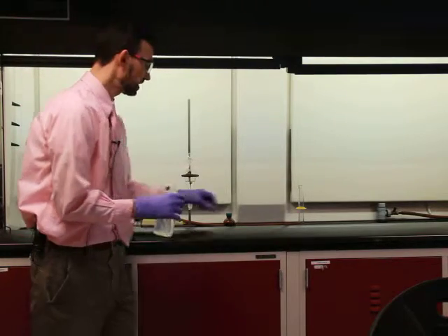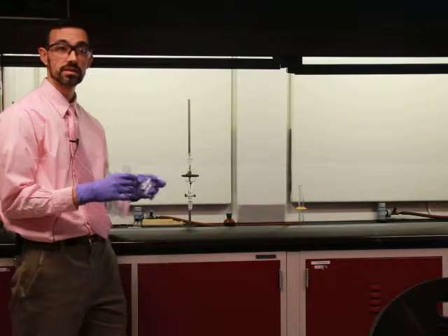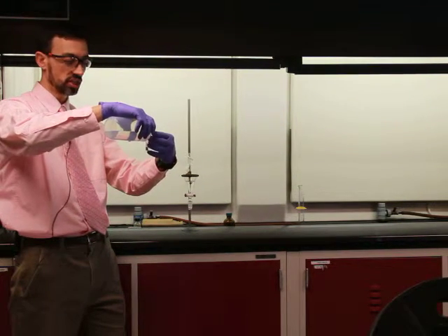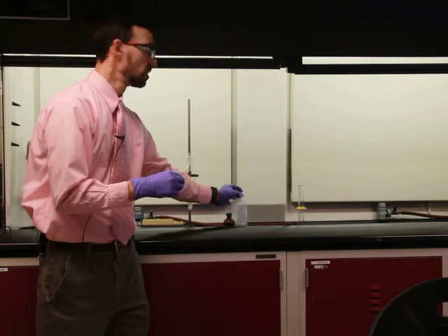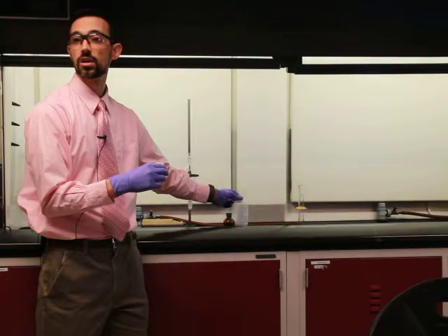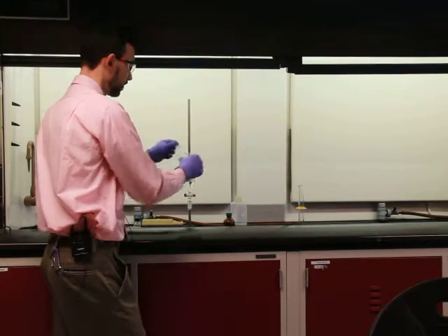So I would like to have about an equal volume of my two solvents. All right. So that partitioning ratio works. That 5-to-1 ratio that I mentioned earlier. If you don't use equal volumes, you're messing up that ratio, because then you have to kind of reconfigure, accounting for a larger volume of one or the other.